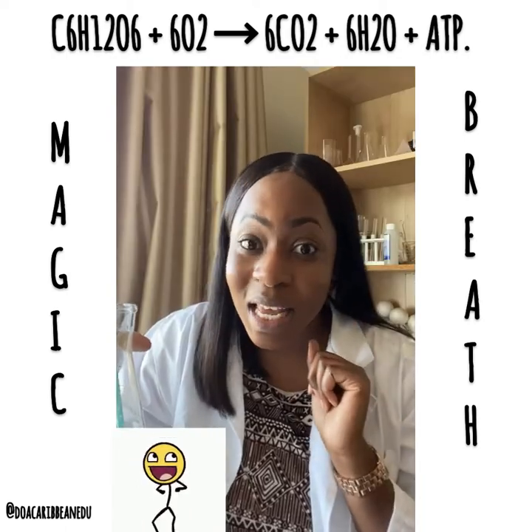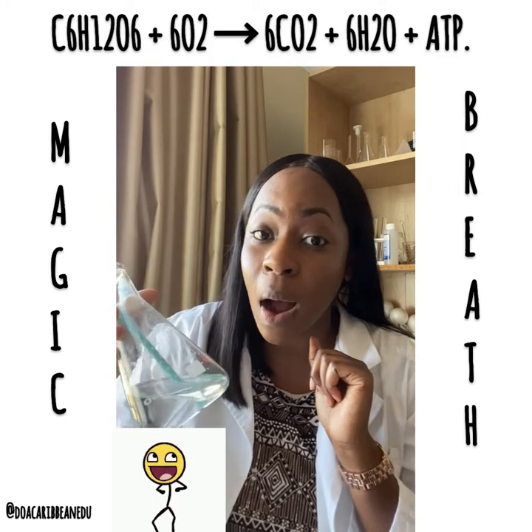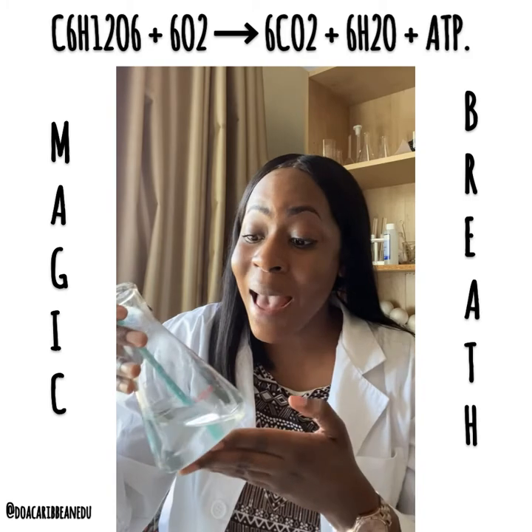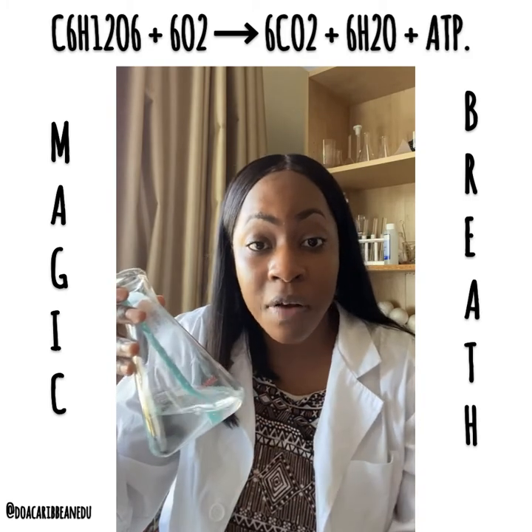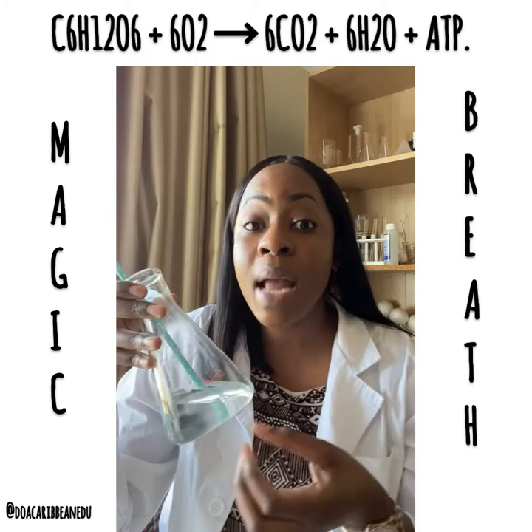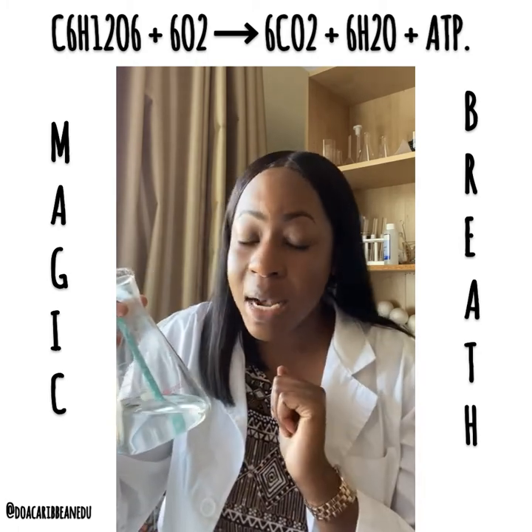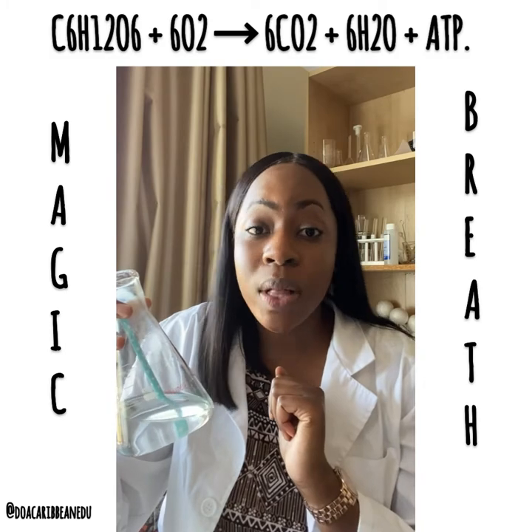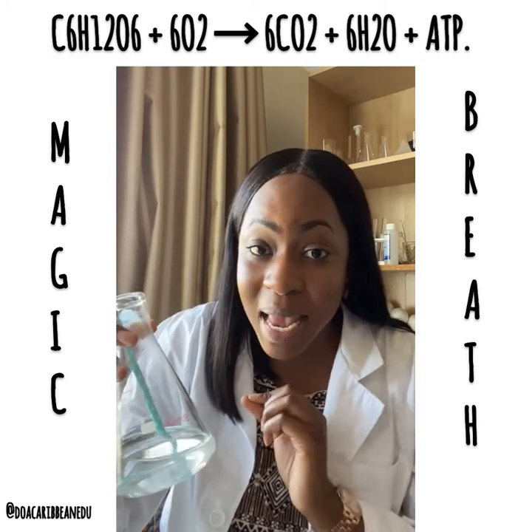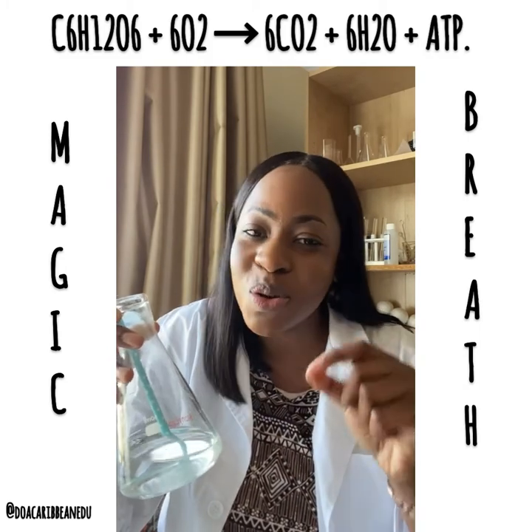Phenolphthalein was pink in the solution with the sodium carbonate because it was a basic solution. When I exhale into this conical flask, I am releasing carbon dioxide, which is going to react to form carbonic acid. Now this carbonic acid will then neutralize the sodium carbonate, thus making the phenolphthalein turn from pink to colorless.